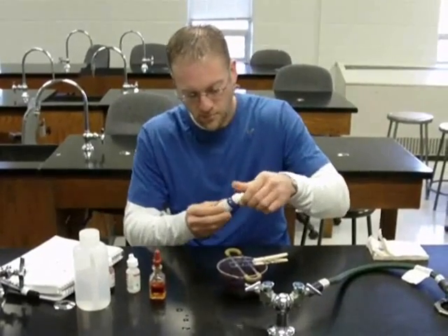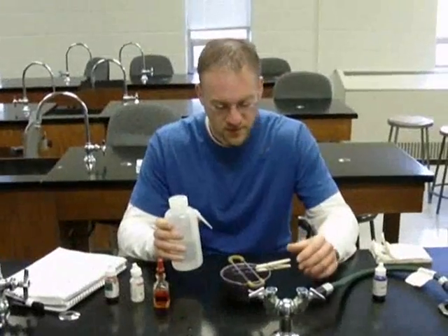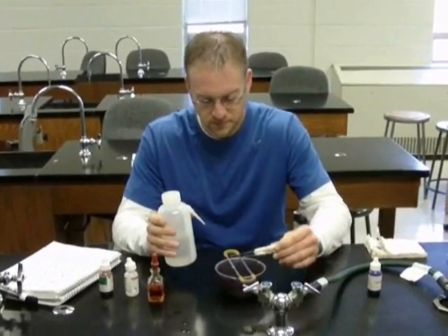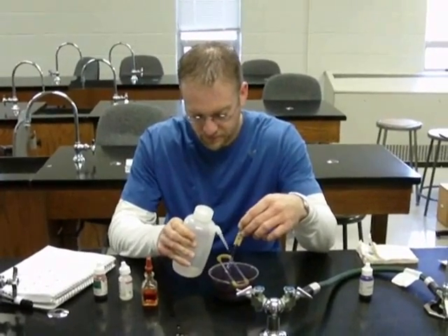We're going to let that react for 30 to 60 seconds. It's been 60 seconds and now Jason is going to rinse with distilled water to remove the excess dye.